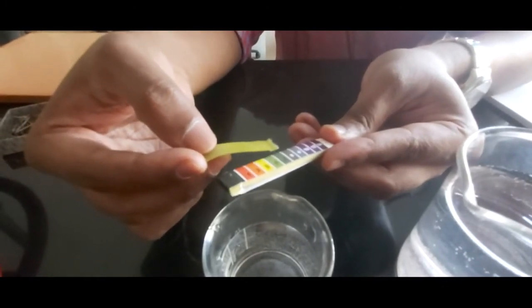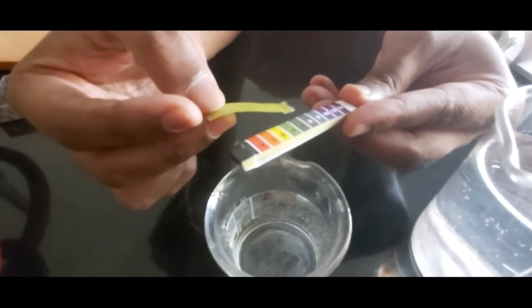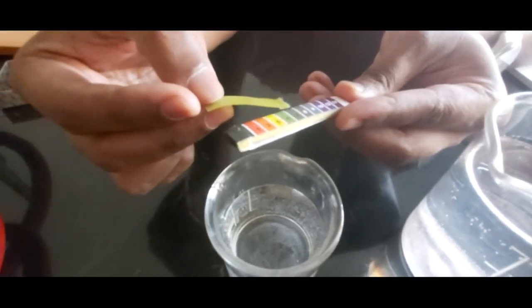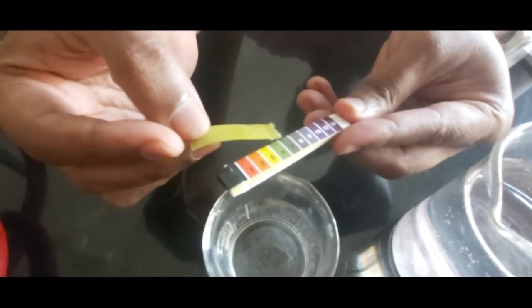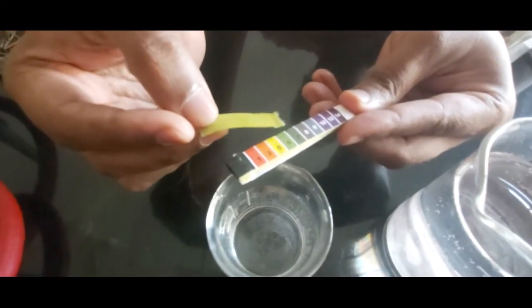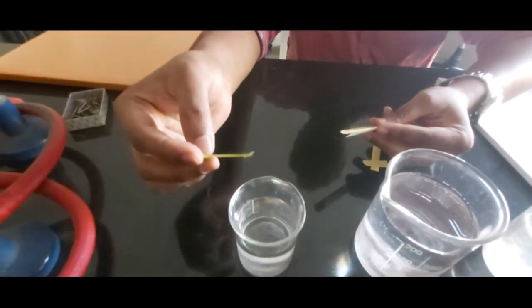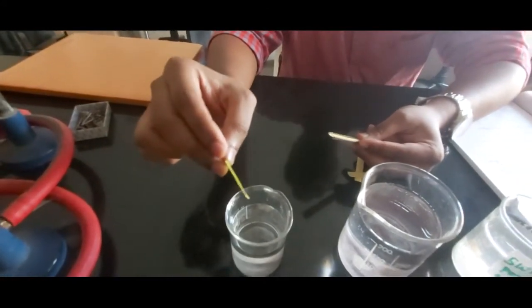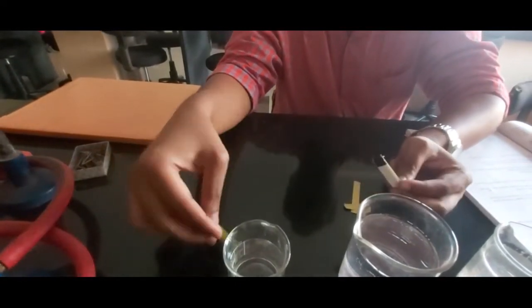We are supposed to match the color on the pH paper along with the standard colors printed onto the cover of the pH paper. Now this distilled water by default will have a pH of 7. If there is a slight change in the pH of distilled water, that means there is a contamination to the distilled water or the beaker we are using is not clean.